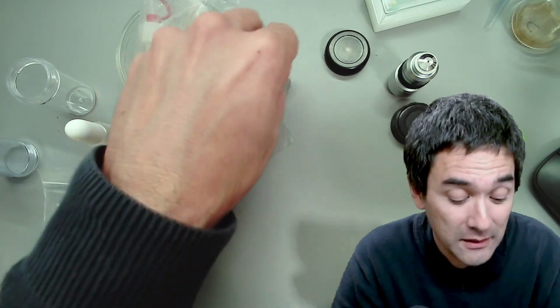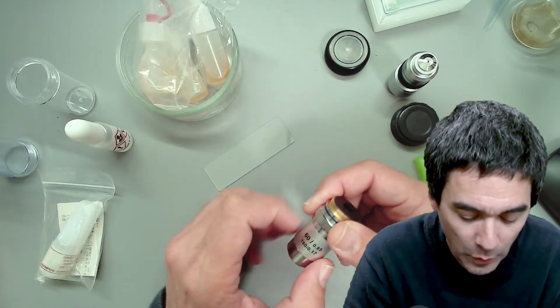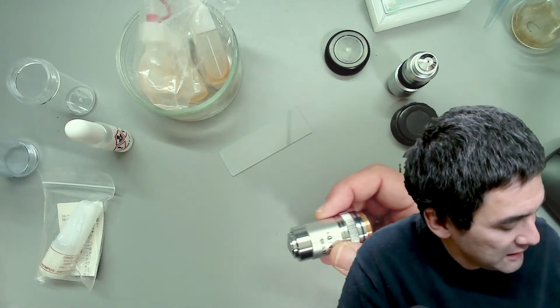So that is basically the thing. We have to be a little bit careful here. When you use oil, you've got to be careful that you don't use the lower magnification. So that's one thing. And the second thing is the following.